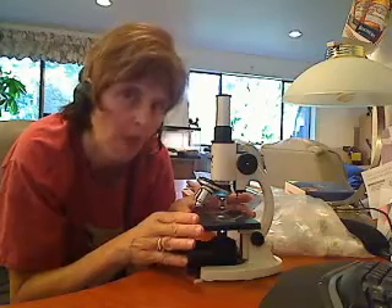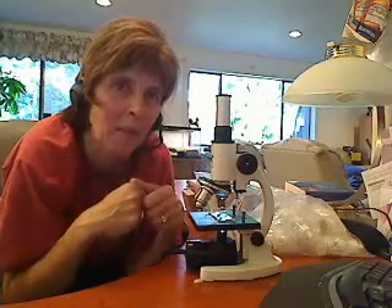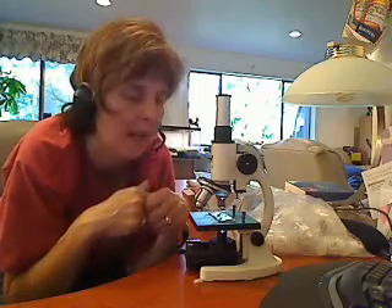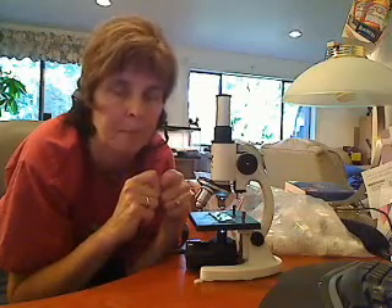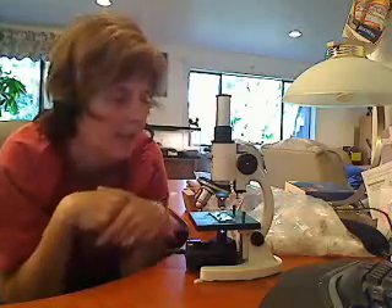It's called a light microscope. Today, of course, they have microscopes that can do fantastic things and magnify by millions and millions of times, so they can actually see inside cells and see the little organelles. But those microscopes are millions of dollars and you have to kill whatever you're looking at — whereas here you can get to see things live.